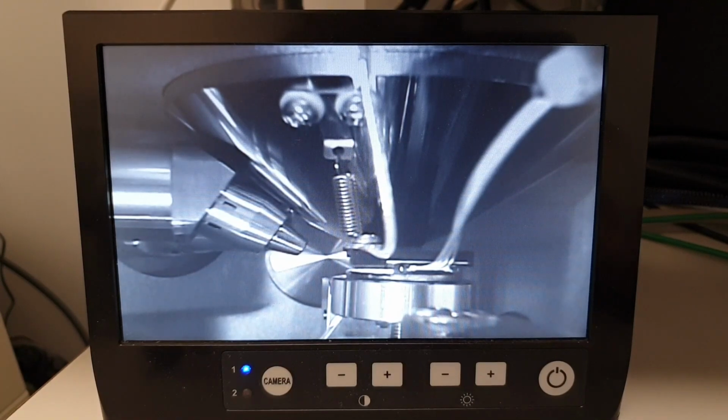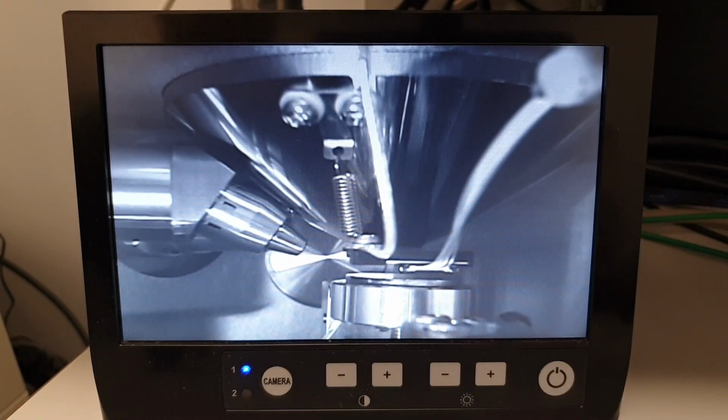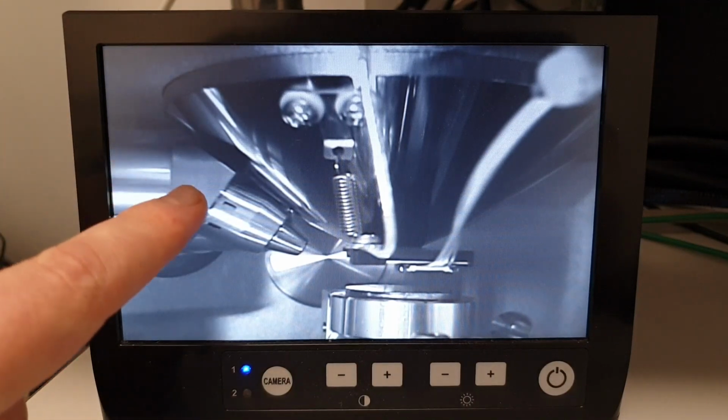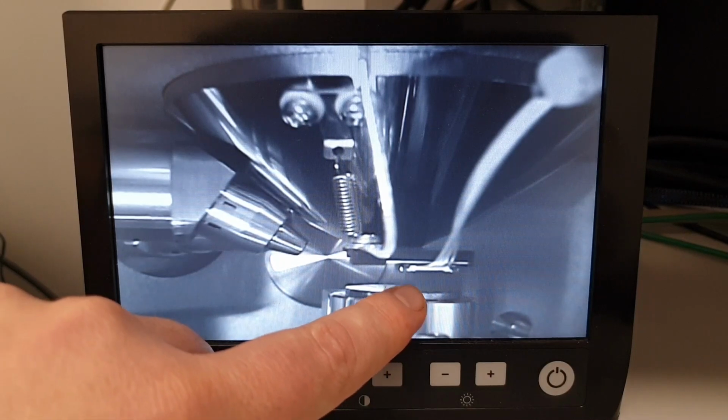When we are reducing the stage position to bring it down into that optimal working distance of about 10 millimeters, you can see the sample stage moving down. And as we come down to that optimal working distance position, you'll note that now the X-ray detector has much better line of sight towards the sample where the X-rays are going to be coming from.